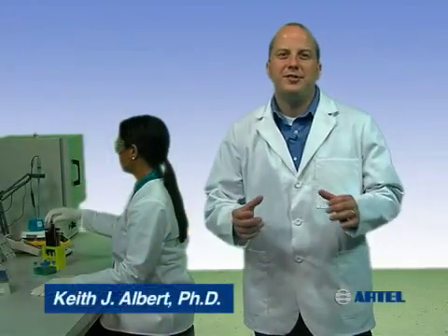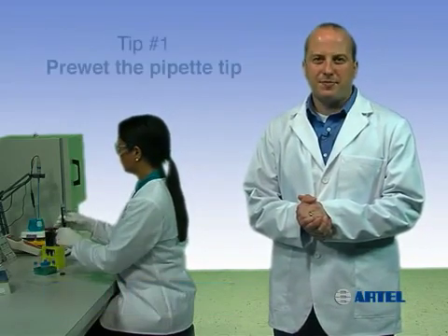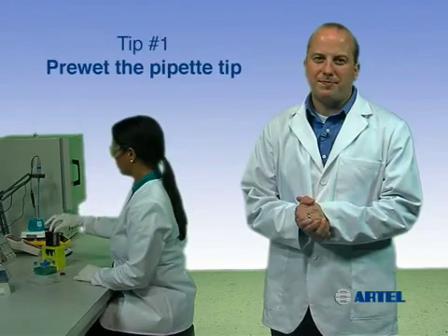Build confidence in your assay results by using proper pipetting technique. Pipetting tip number one: pre-wet the pipette tip.